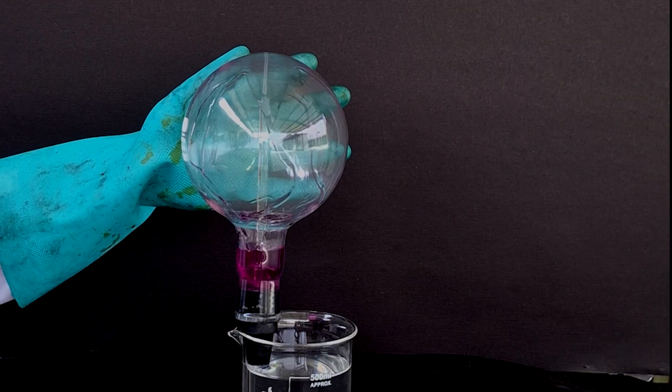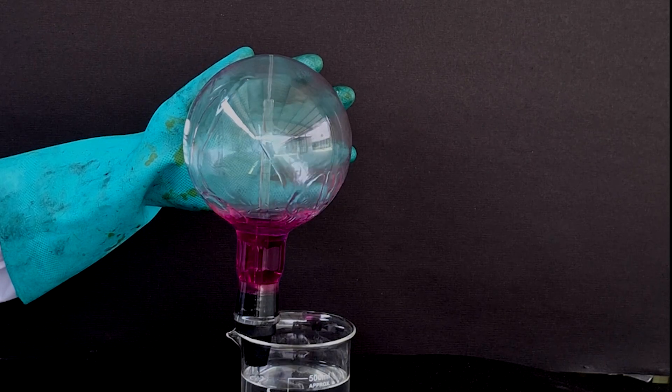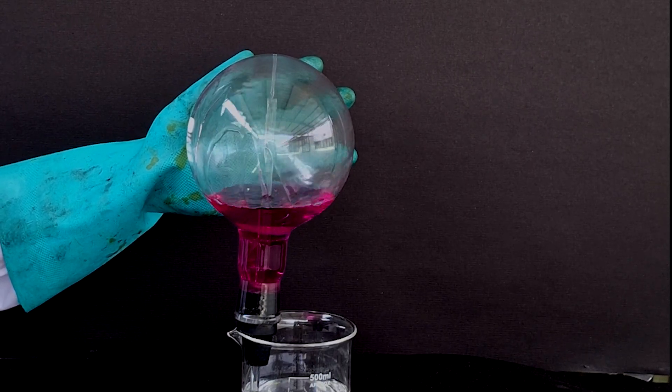There are plenty of methods to prove ammonia is soluble in water, but none are more eye appealing than the ammonia fountain.